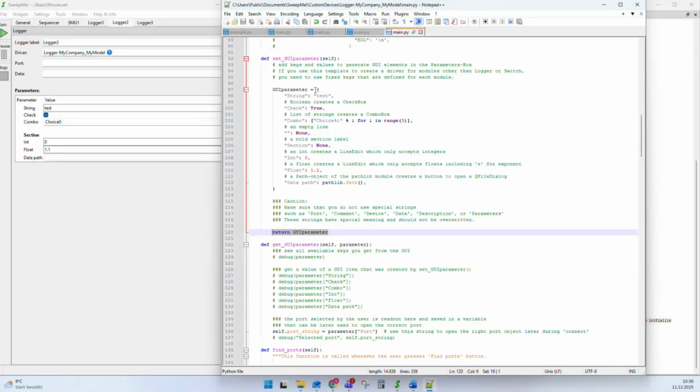SweepMe then looks into the dictionary and takes a key of the dictionary. And this key is then used as the name of the variable, like here, string, check, combo. So these are just exemplary names for these types of user interaction fields. And depending on the value in this dictionary, it creates the user interface. For example, if you hand over a string, SweepMe creates a line edit for entering a string with the default value test. If you use a Boolean, it uses this true, creates a checkbox and makes it already checked. If you make it false, it will be unchecked as a default.